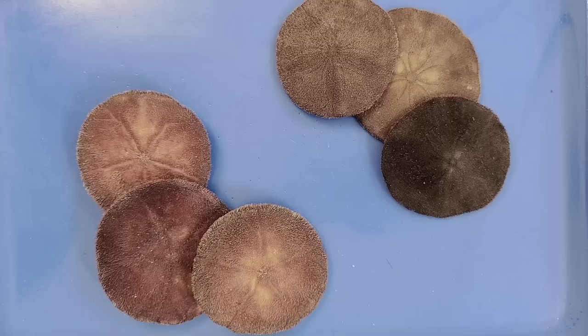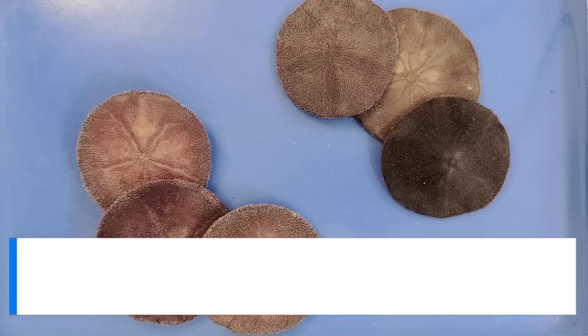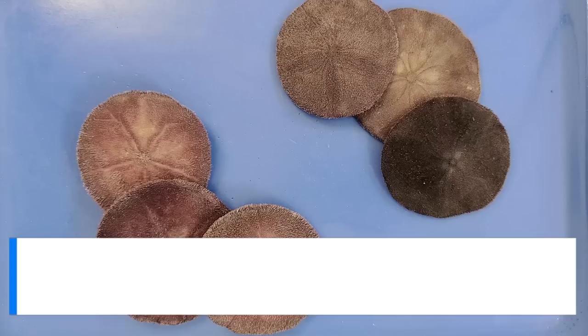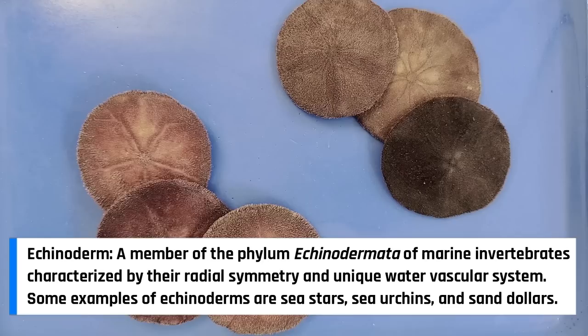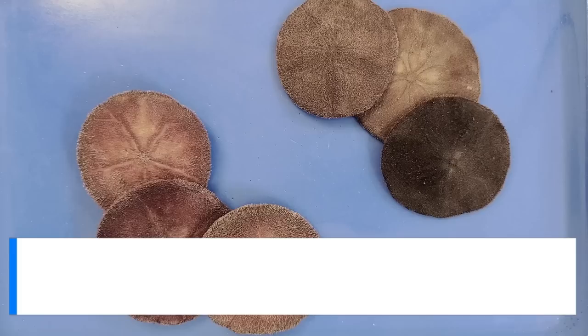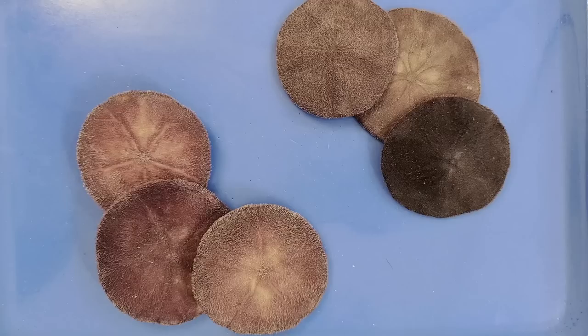Hello and welcome. Today we'll be taking a look at the anatomy of a sand dollar. Sand dollars are part of a group of animals called the echinoderms, which also includes animals like sea stars, sea cucumbers, and sea urchins. As you'll see in the video, sand dollars have a lot in common with sea stars and sea urchins, both of which we've covered in previous videos.